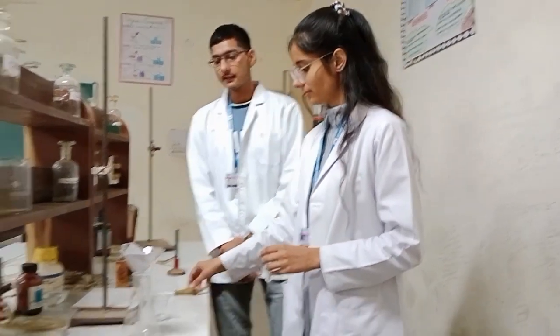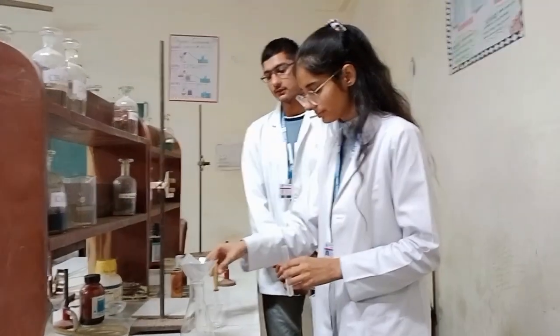Confirmatory test for Pb2+. First of all, we will add dilute HCl to the solution.